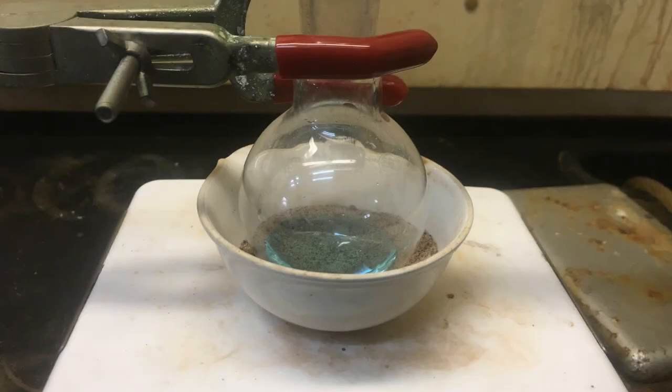This is the mixture before distillation and then this is the distillate afterwards.